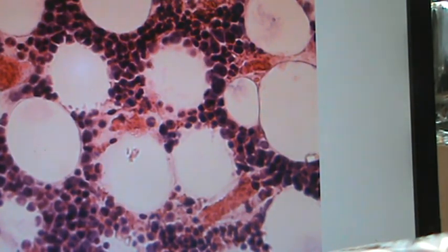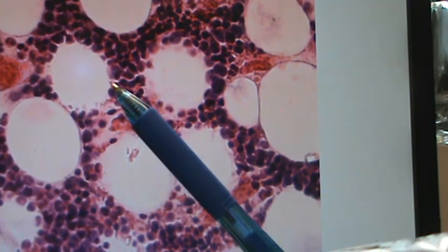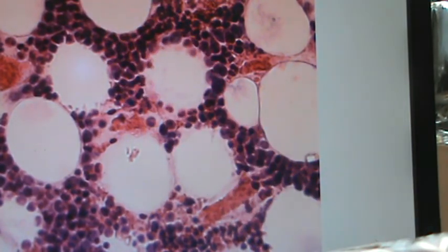Believe it or not, this is blood. If you take the blood cells, these are the hematopoietic stem cells that we see in blood, and where this is located is in the bone marrow. So we took the bone, and the bone was dissolved, and all you see are these really big stem cells that are down here that are going to end up giving rise to the erythrocytes and the leukocytes and the platelets. So let's go on.